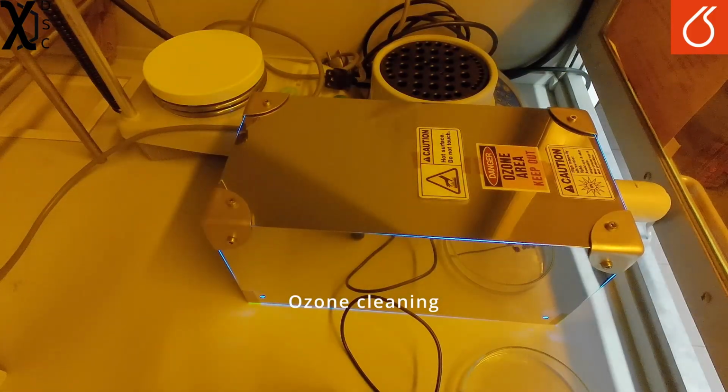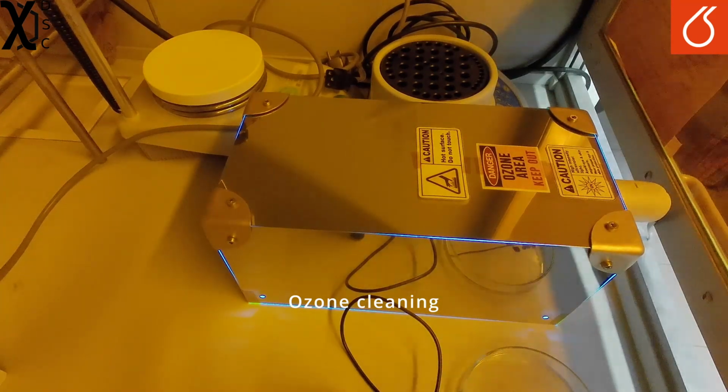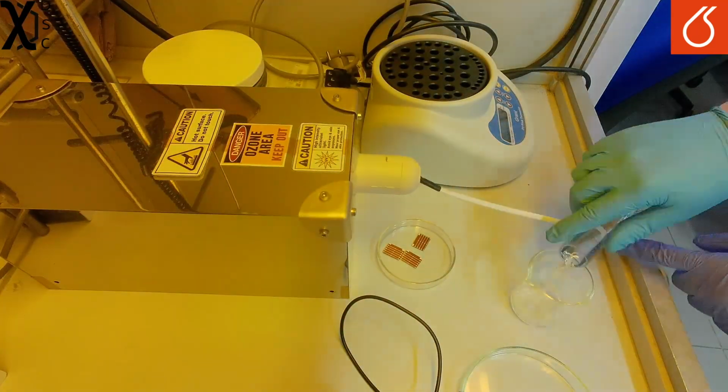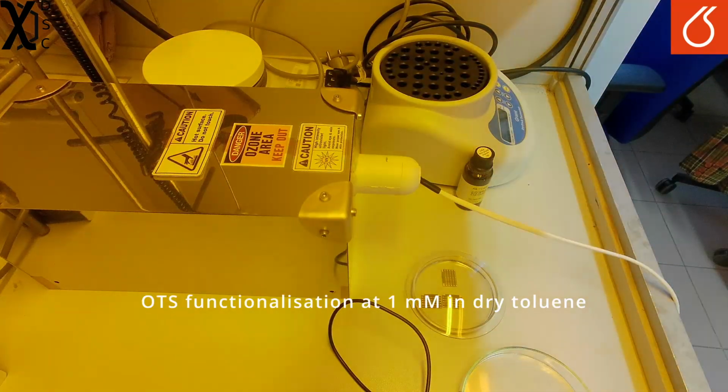There are multiple ways to do this, but here I am using ozone cleaning. Ozone is toxic and produced by carcinogenic UVC light, so caution must be used here, as well as a ventilated fume cupboard. The light source used is linked below. The substrate is exposed to ozone for only 5 minutes.